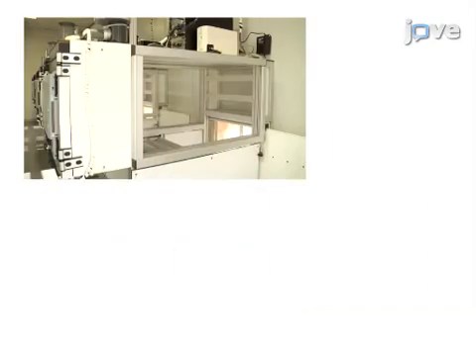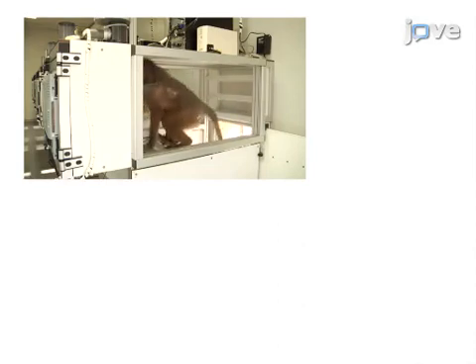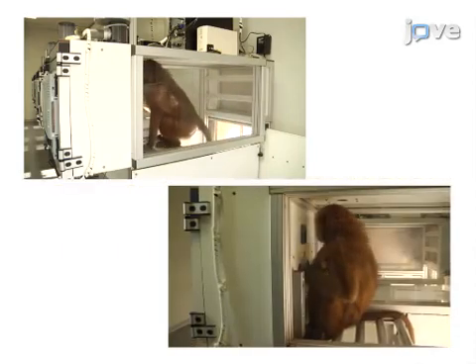The RFID microchip reader captures the numeric identity of the monkey when it enters an ALDM test unit, and the test program displays cognitive experiments and records which animal uses which ALDM test and when.